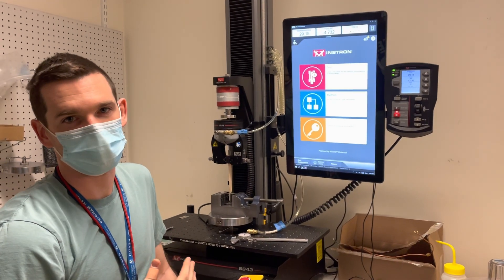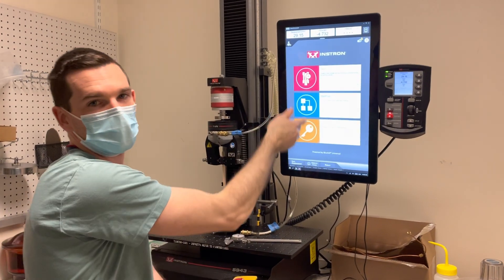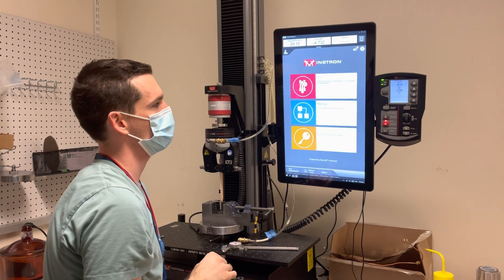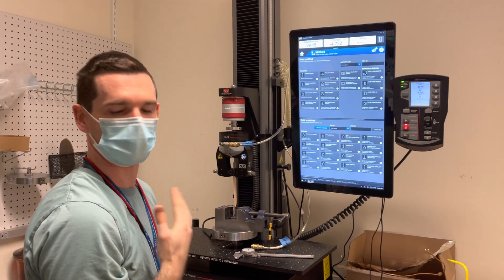This training is to show you how to set up a new test method. In your starting screen, you choose method. I've already set up a new one.